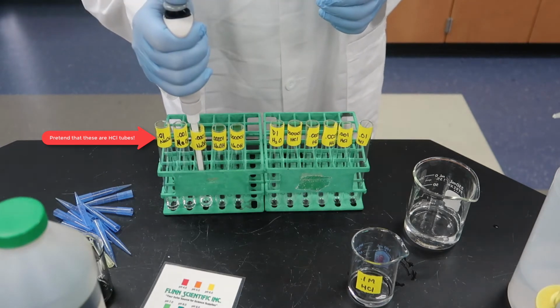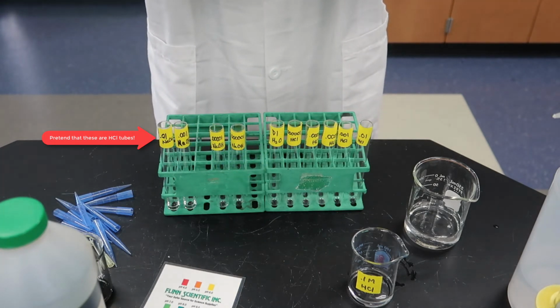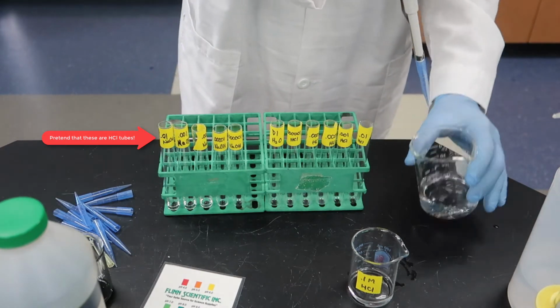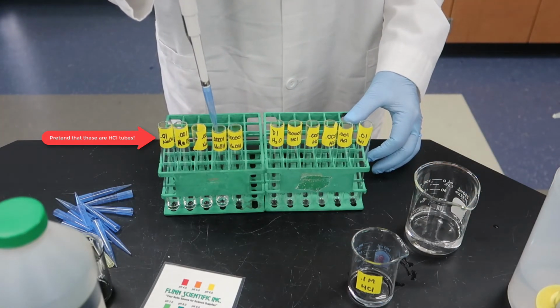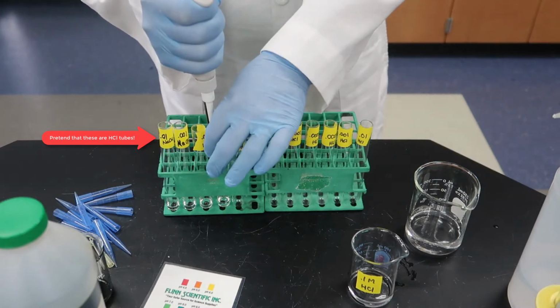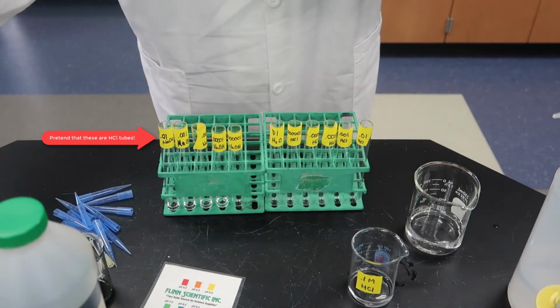And again, 100 microliters from the 0.0001 tube to our next one. Each time we're diluting by a factor of 10. And adding the water. 900 microliters of water. Last tube, we'll take 100 microliters from the previous tube, add it to our last tube, we'll add the 900 microliters of water.